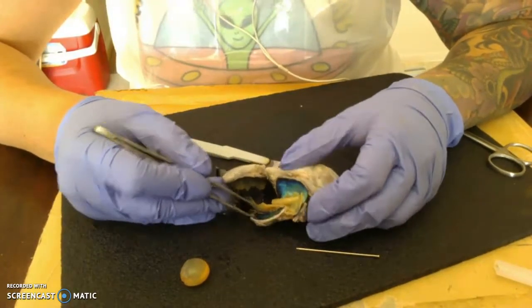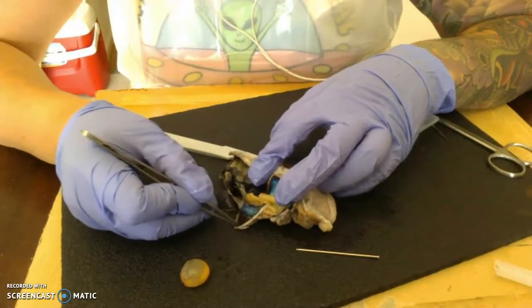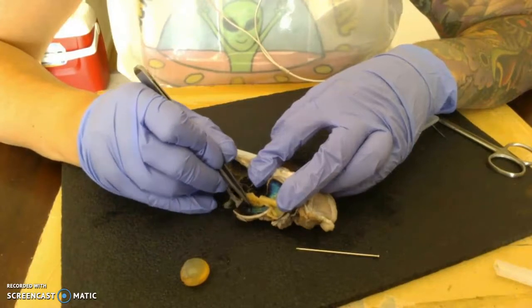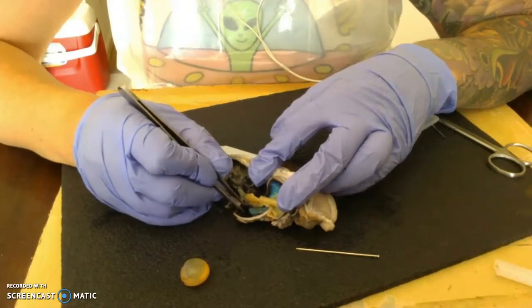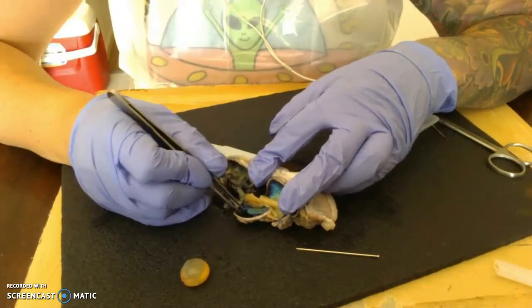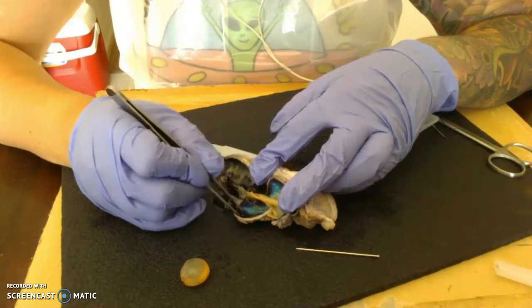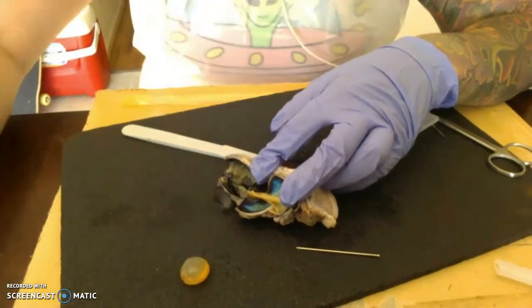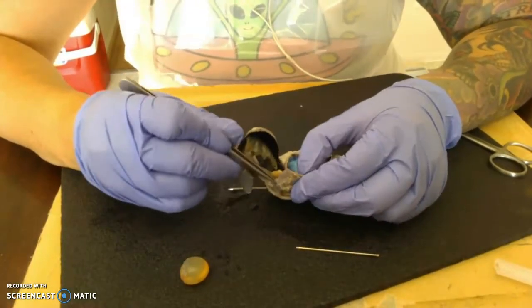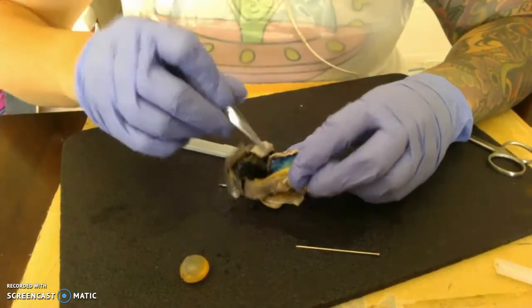Then we go into the more superficial layer of the internal eye. This is this layer right here. This is the choroid. Retina, choroid, and then this is the tapetum lucidum. I can't remember what it's called, but this is so that the sheep can see at night, with them being nocturnal animals. And then we can go into our thick layer, which actually forms the eye in the white aspect when we see eyes, which is the sclera.